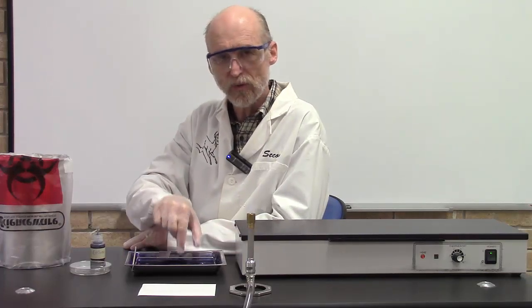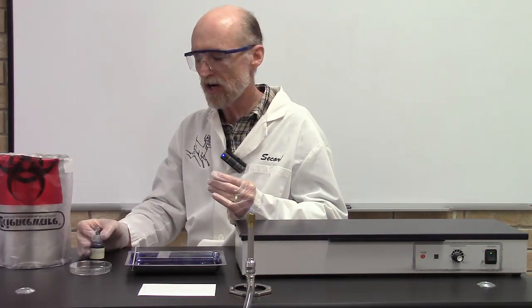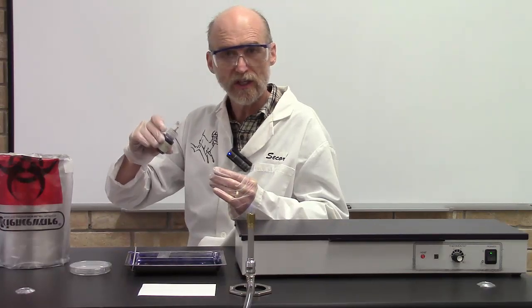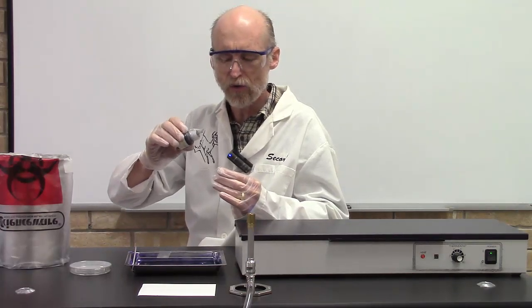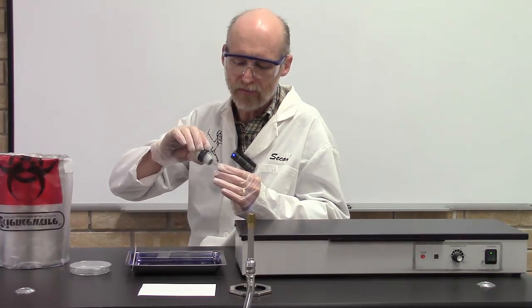Let's look at the technique itself. First, what you want to do is take one of your slides and put a small drop of nigrosin near one end. Don't get it on your fingers. So I go about probably a half inch from the end of the slide. I put a little drop of nigrosin.